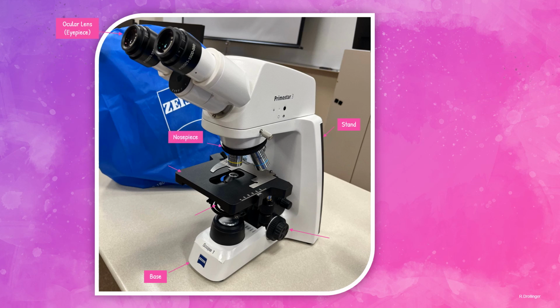This is the nose piece, which is what holds the objective lenses. It can be rotated easily to change the power of the objectives. These are the objective lenses. I'll discuss these later on, but these usually consist of 4x, 10x, 40x, and 100x powers. These are a way to relay an image of the object on the slide to the ocular lens. Next is the stage, the flat platform where microscope slides are placed to view them. The metal colored pieces on the stage are the clips that help to hold the microscope slides in place.